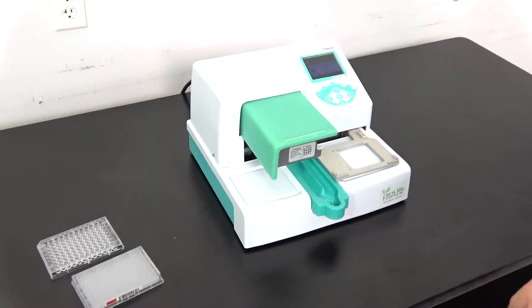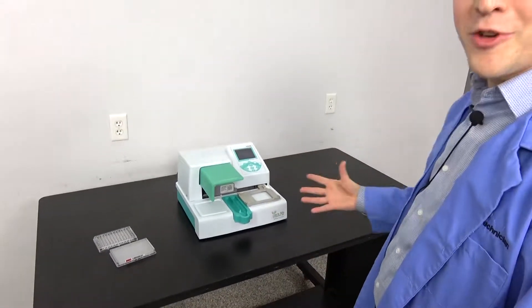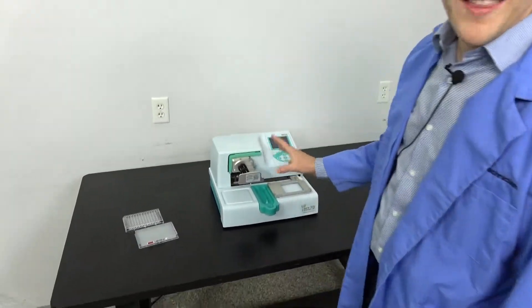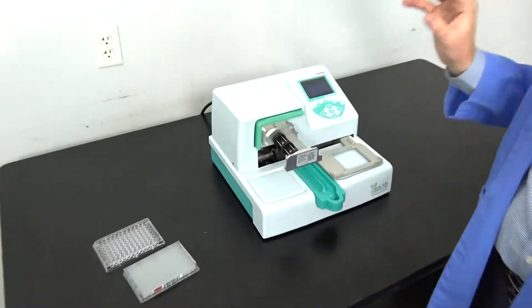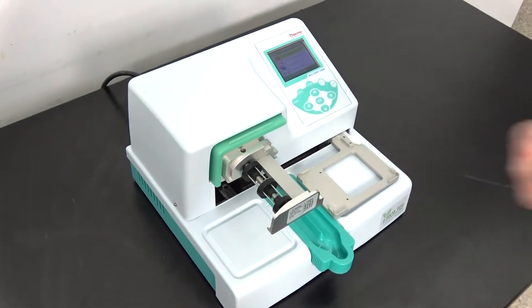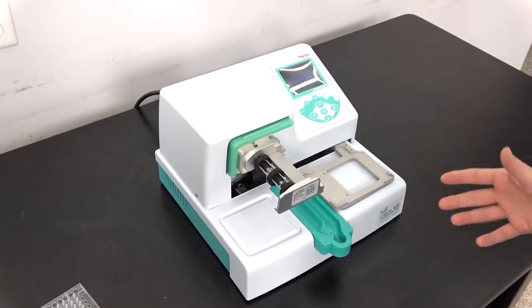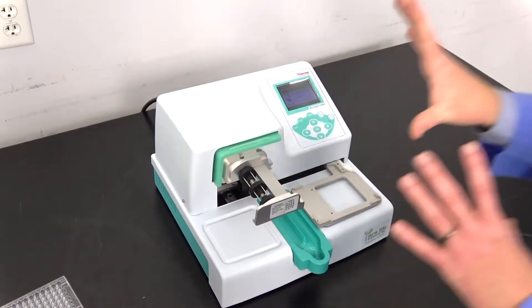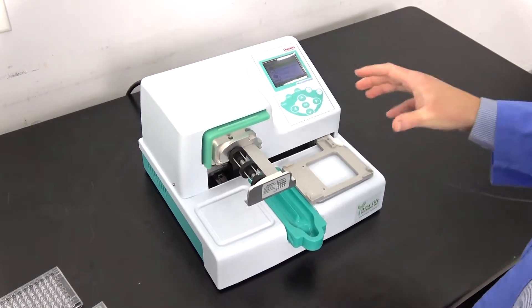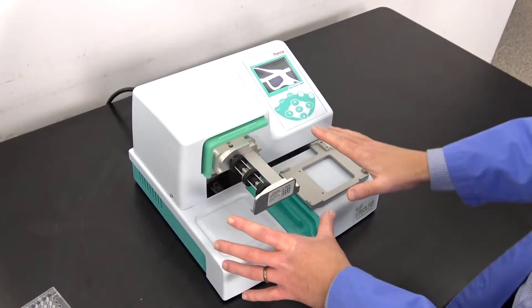And you do it whenever you want. There's not a lot of setup — you drop the plate in, you press a few buttons, and it goes. Today we're running one without a cassette. You're going to have to buy a cassette for this machine depending on what tube diameter and volumes you want to dispense. We're not supplying the cassette, but fortunately this still runs without one so you can get a look at how it's operating.